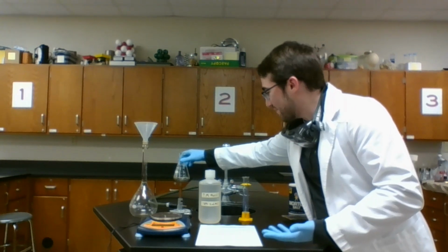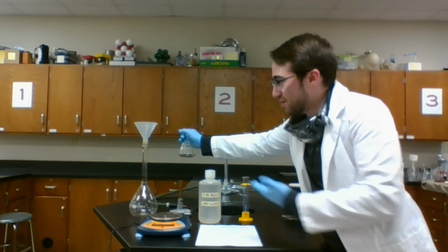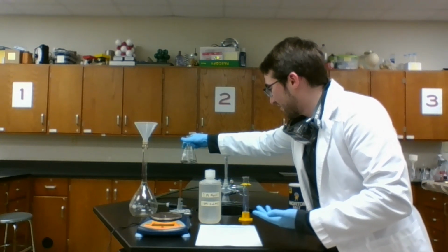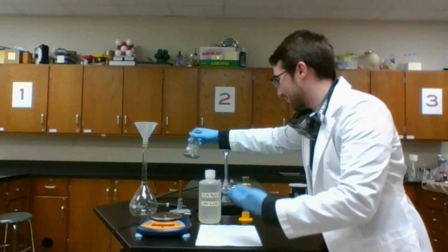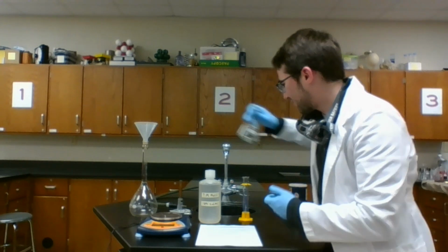I'm not going to have a flame. I could try and clamp it above with a rod and a clamp, but that's not super safe either. I'm going to have to grab it at some point. I don't want to just have to wait forever for it to cool off. So that's not too good either.